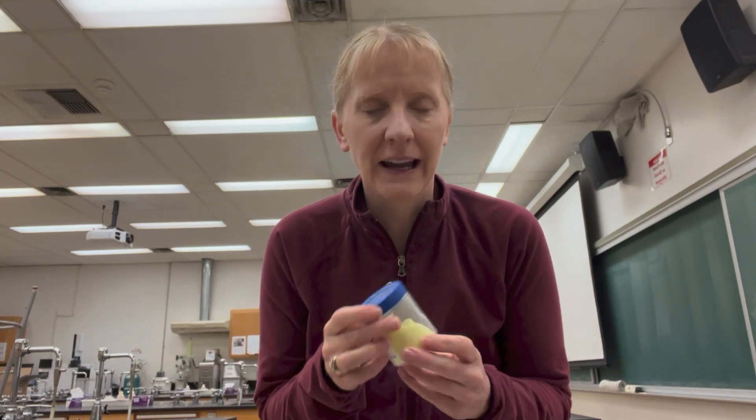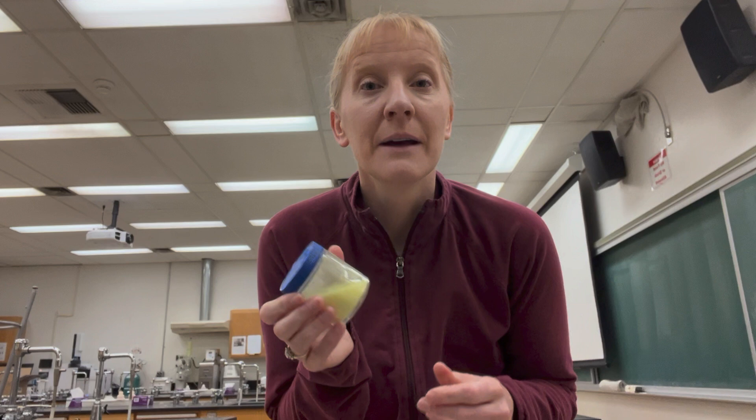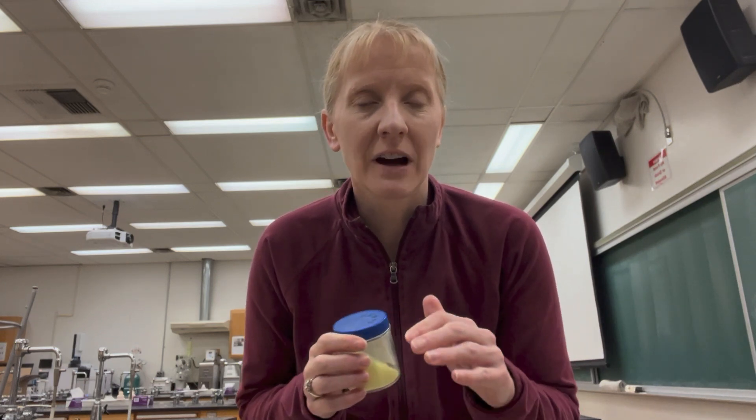Hi everyone, my name is Lisa Nichols and today I'm going to show you how to take an IR of a solid by first making a KBR pellet and by using a benchtop two-ton KBR press.